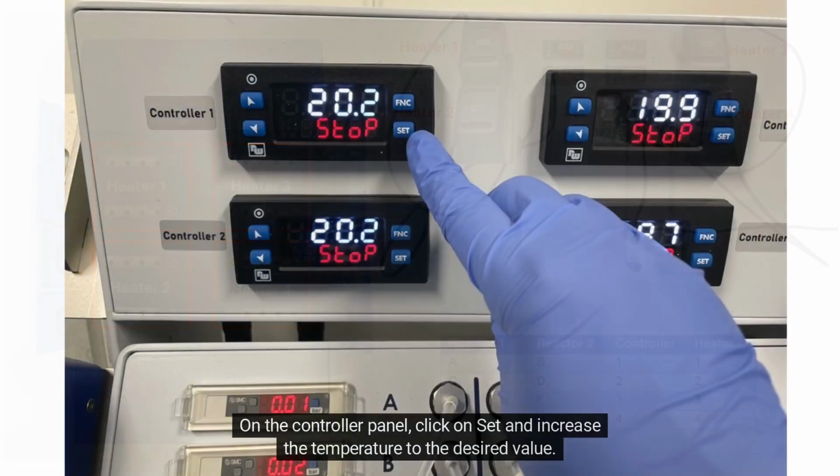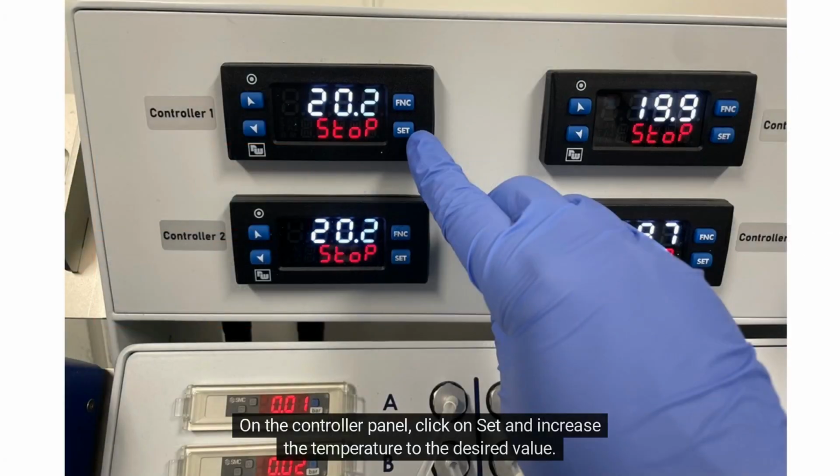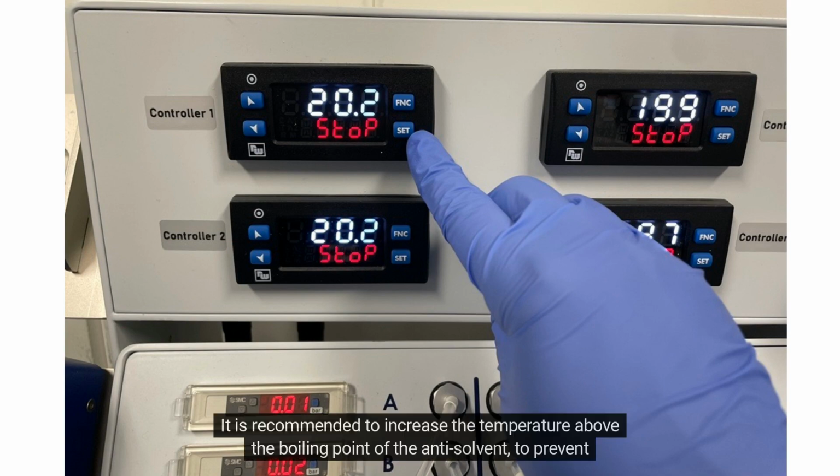On the controller panel, click on Set and increase the temperature to the desired value. It is recommended to increase the temperature above the boiling point of the antisolvent to prevent condensation.